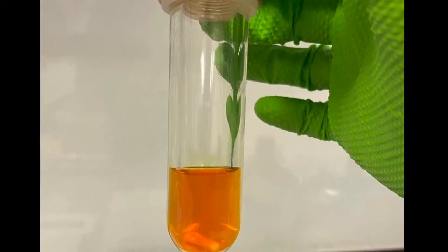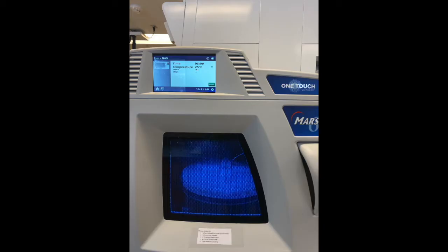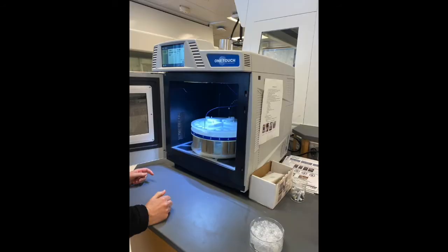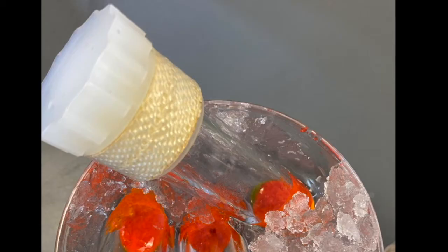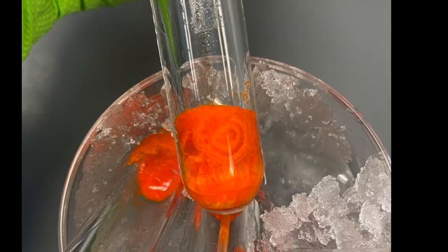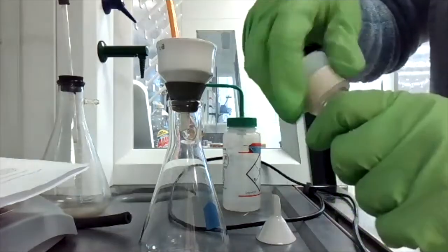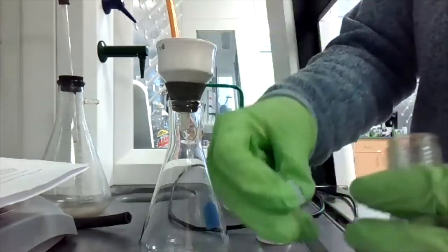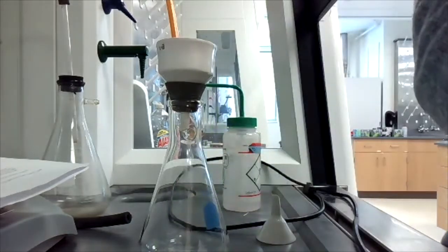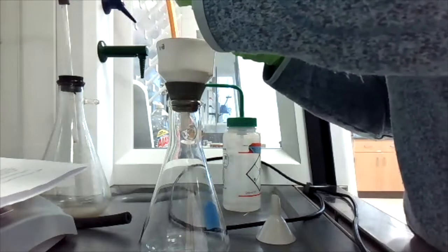This is what the reaction mixture looked like going into the microwave. The reaction vessel is then placed in the microwave where the reaction will occur. Once the product is cooled enough to be taken out, the product is placed in an ice bath to assist in the formation of crystals. This is what the product looks like once the crystals have formed. Now, since crystallization is complete, the product can be collected by vacuum filtration and washed with cold ethanol to make sure all the product is collected.